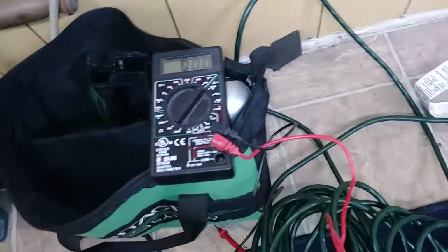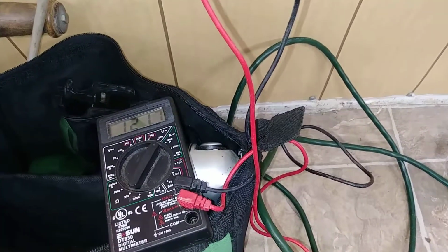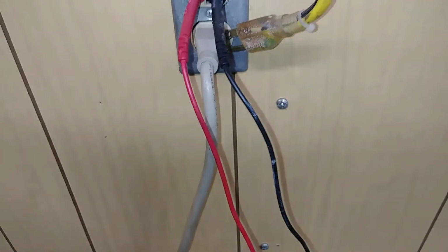And just to show you that the meter itself is not faulty, I'm going to take the direct power source from where I was just using it, okay? And I'm going to show you that this works. So I'll stick that lead in there, stick this lead in here, and you'll see the voltage. 121 volts, okay? Right? Watch. 121 volts. Do you understand what I'm saying?